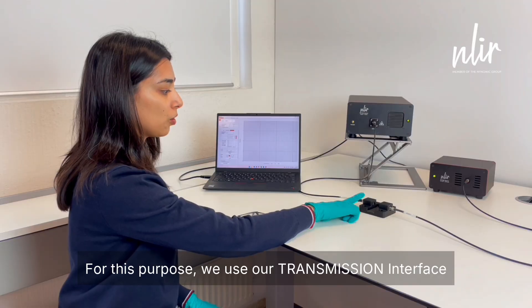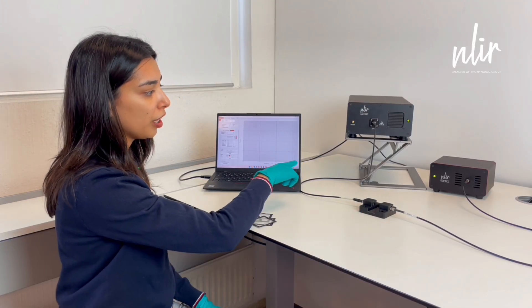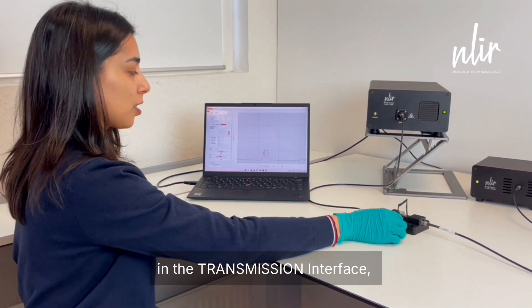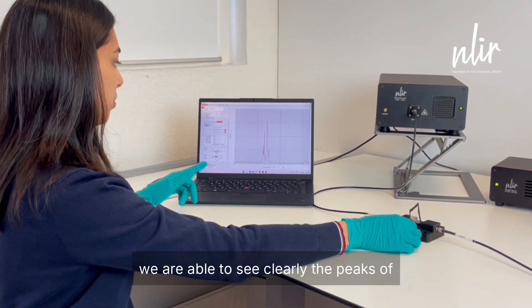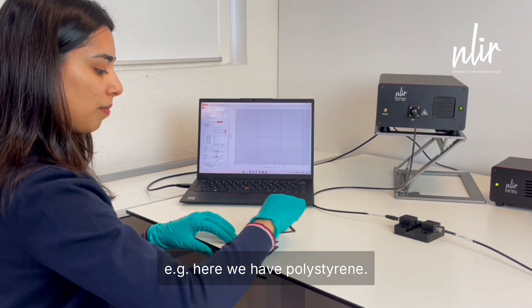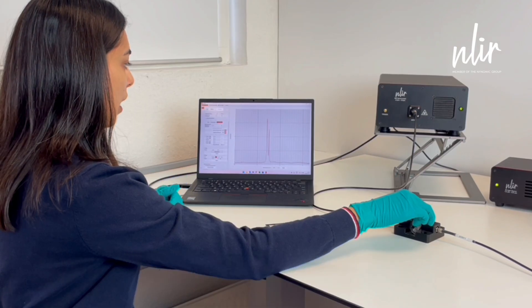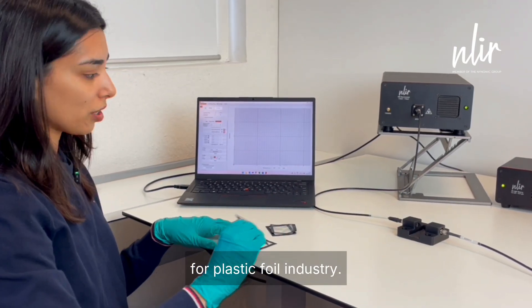For this purpose we use our transmission interface connected to our mid-wave spectrometer and the fiber light source. As you can see, when I put the sample in the transmission interface we are able to see clearly the peaks — here we have polystyrene — and it is to demonstrate how we are able to differentiate between different plastics and the advantage of using the spectrometer for the plastic foil industry.